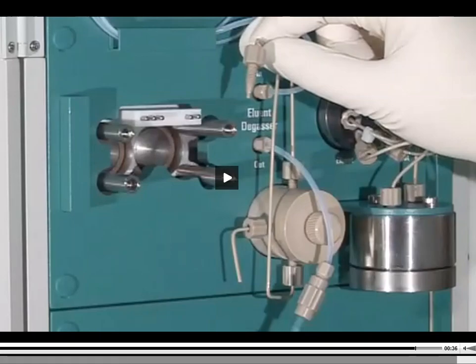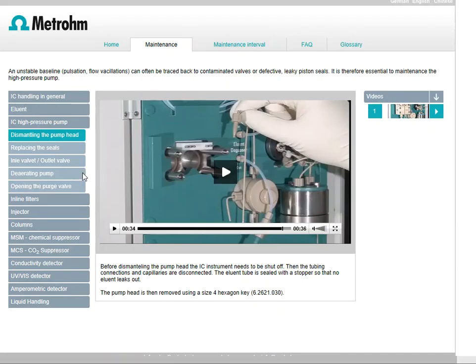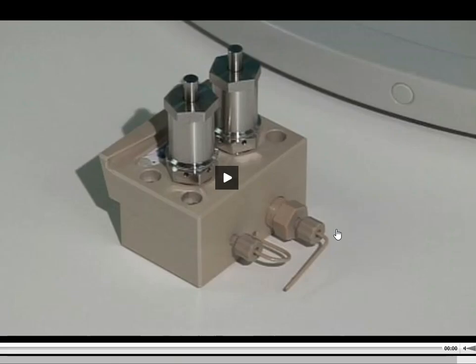All right. So now over here to the side, I'm going to hit this link that says replacing the seals. Remember, I told you that there's things on the inside of the pump, and these are things that you can do on your own, and you don't need any kind of person to come out to do this maintenance for you. Right here are the dual pistons. Dual means two, so you see one there and one there. This kind of metal bar that's sticking up out of the top is basically going to slide in and out, in and out, in and out, and that kind of creates your pumping action or your sucking action and all of the force that needs to be behind the mobile phase to push it through the column and out the other end.